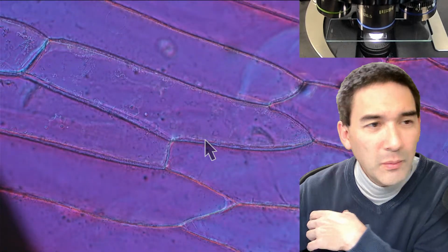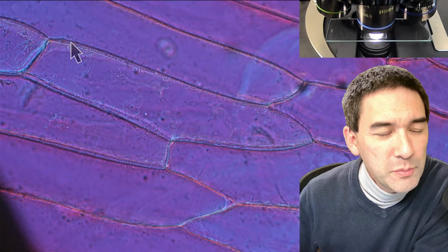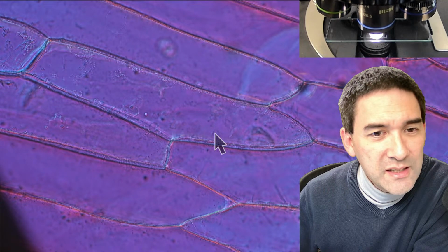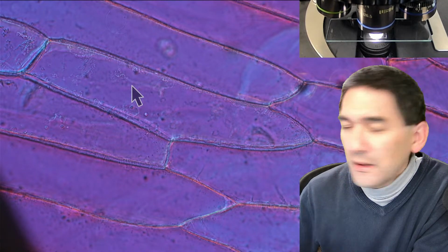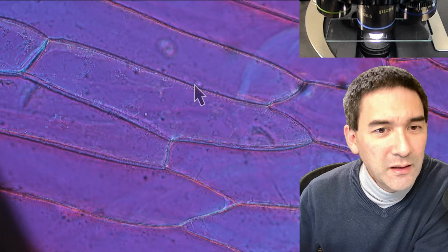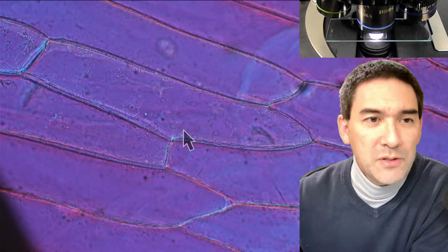What you see over here is that on the side, the question is, do they have a vacuole? What do you see on the side here? Those dots on the side seem to be the nucleus. This is where the cytoplasm is. This dark line on the outside is the cell wall, and the whole thing on the inside here is the vacuole. So it's huge. But if you really zoom in, you're able to see that the vesicles, those little tiny dots, are actually moving only on the outside here. So the cytoplasm of the cell is pressed really far to the side, towards the cell wall.